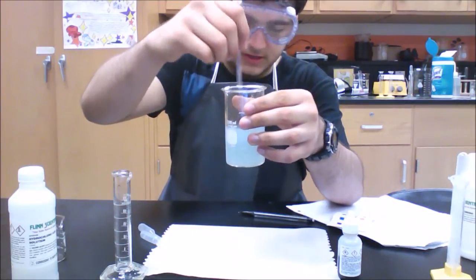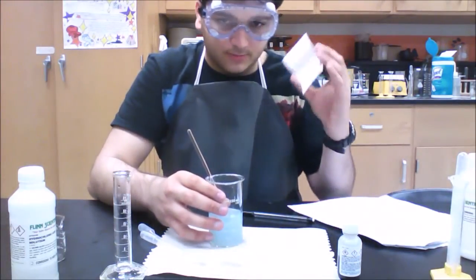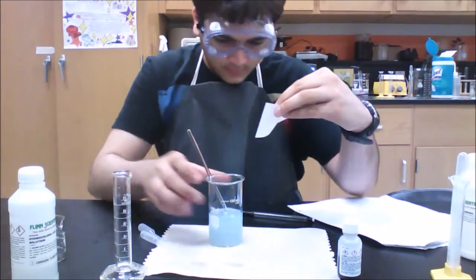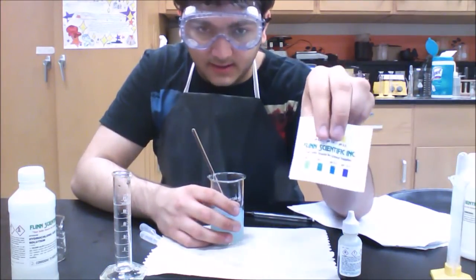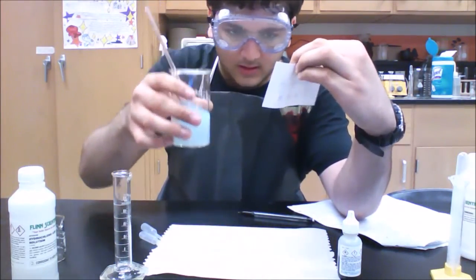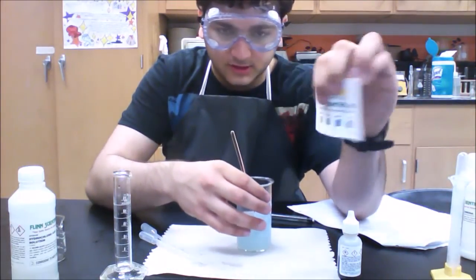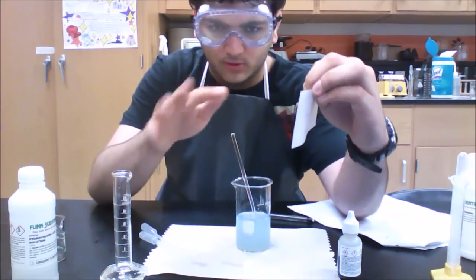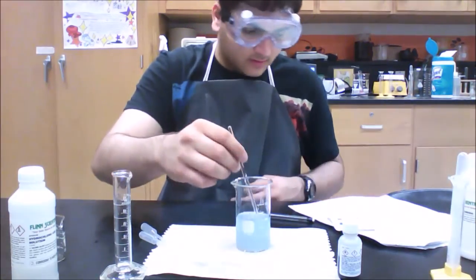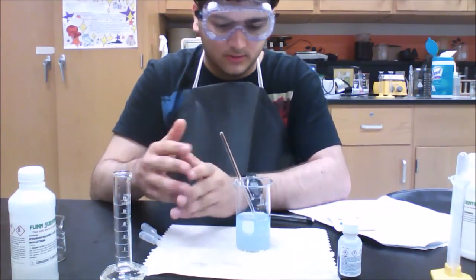And keep stirring, to make sure the particles are all mixed throughout. And if you look back at your pH chart, it is now between 8 and 9, because it's lighter than the dark blue that they show at 9, and it's not a green like they show at 8, so you can say between 8 and 9, so 8.5. So that's just if you want to observe more of Le Chatelier's principle working throughout this experiment.